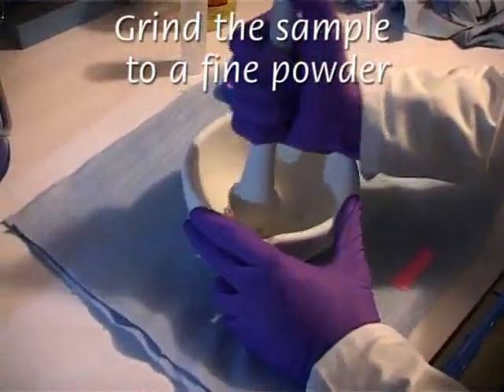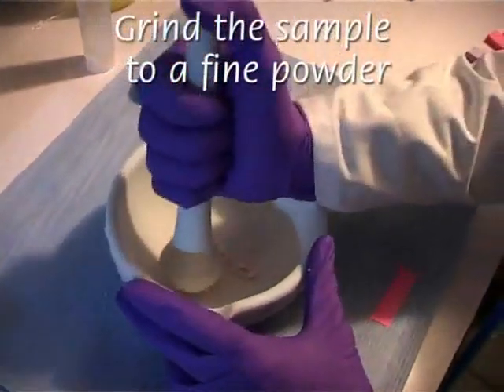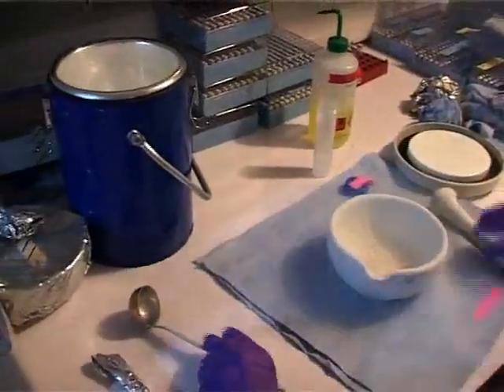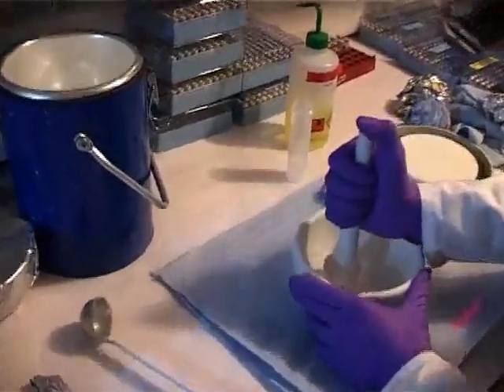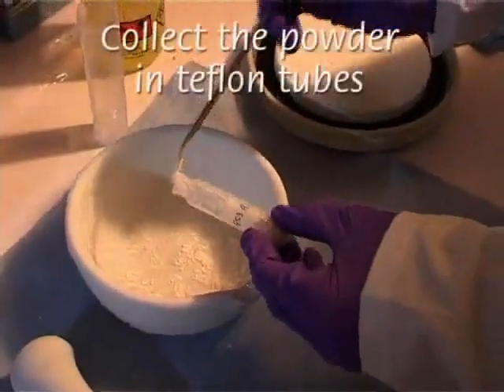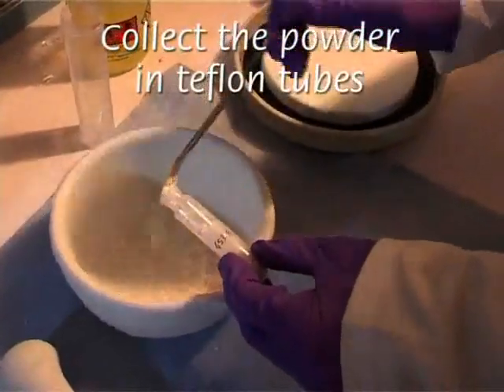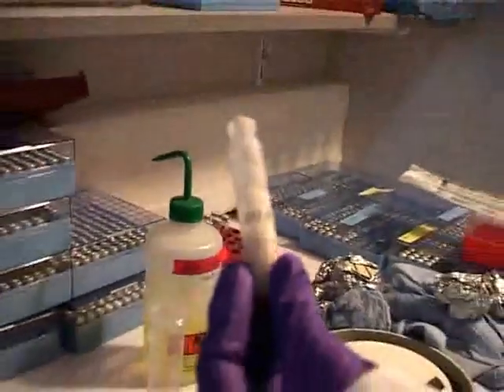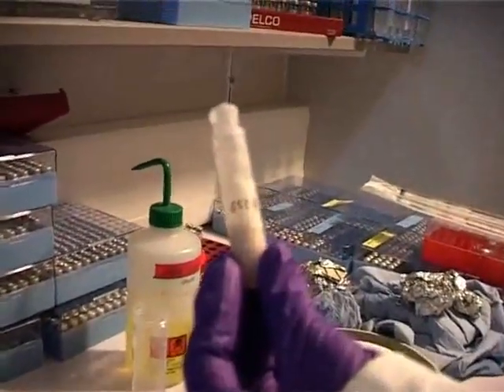The sample is ground in a sterile mortar using liquid nitrogen until the mycelium is a fine powder. This step is crucial for the quality and amount of proteins. Mycelium is collected in 10 ml Teflon tubes in a proportion of 4/10 of the total volume of the tubes.